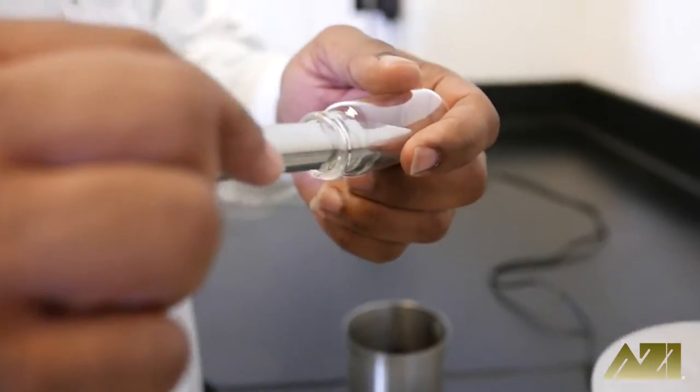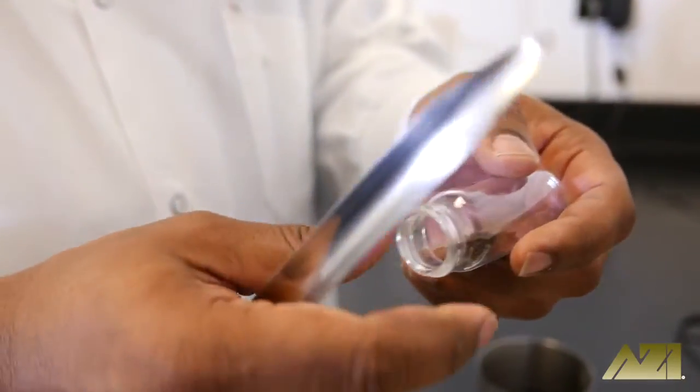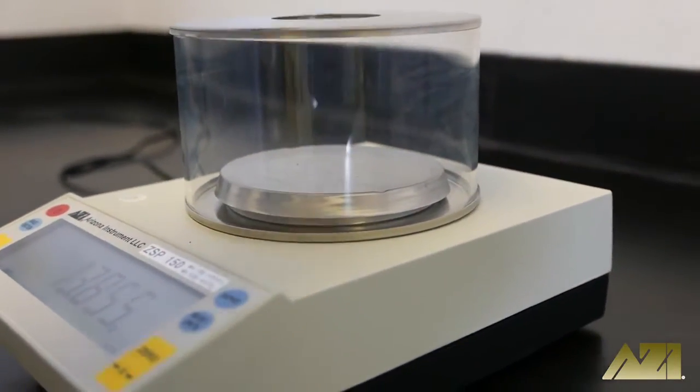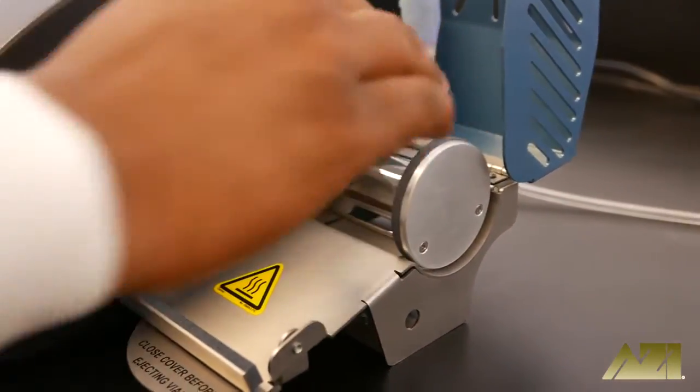After weighing the samples in the respective sample bottles, we placed them in the bottle transport, entered their weights in the moisture analyzers, selected the correct program and started the test.